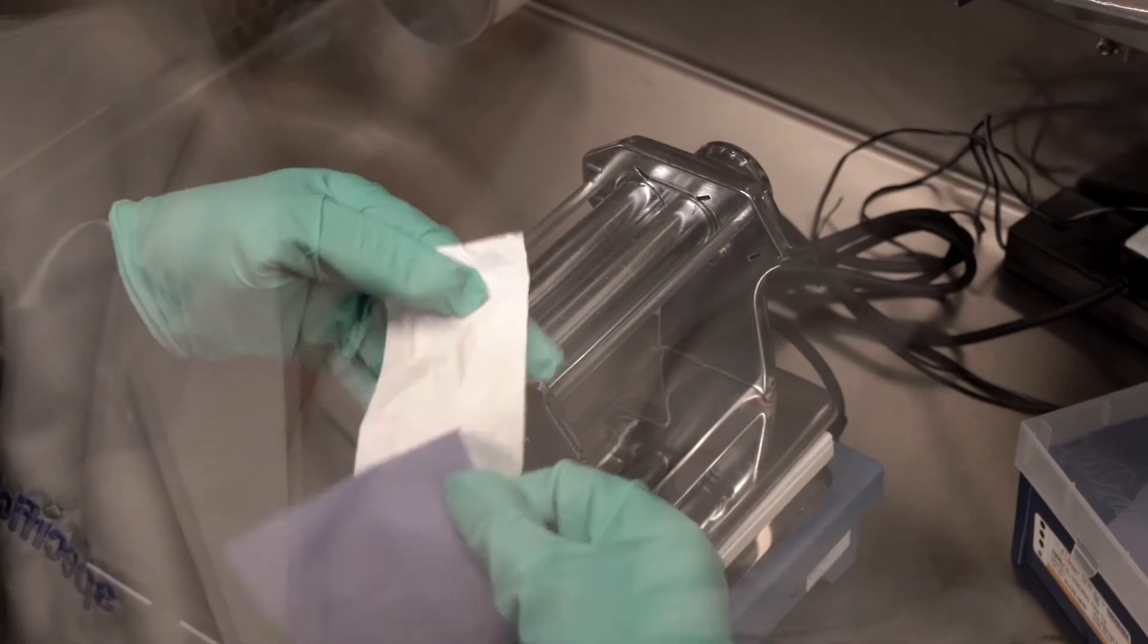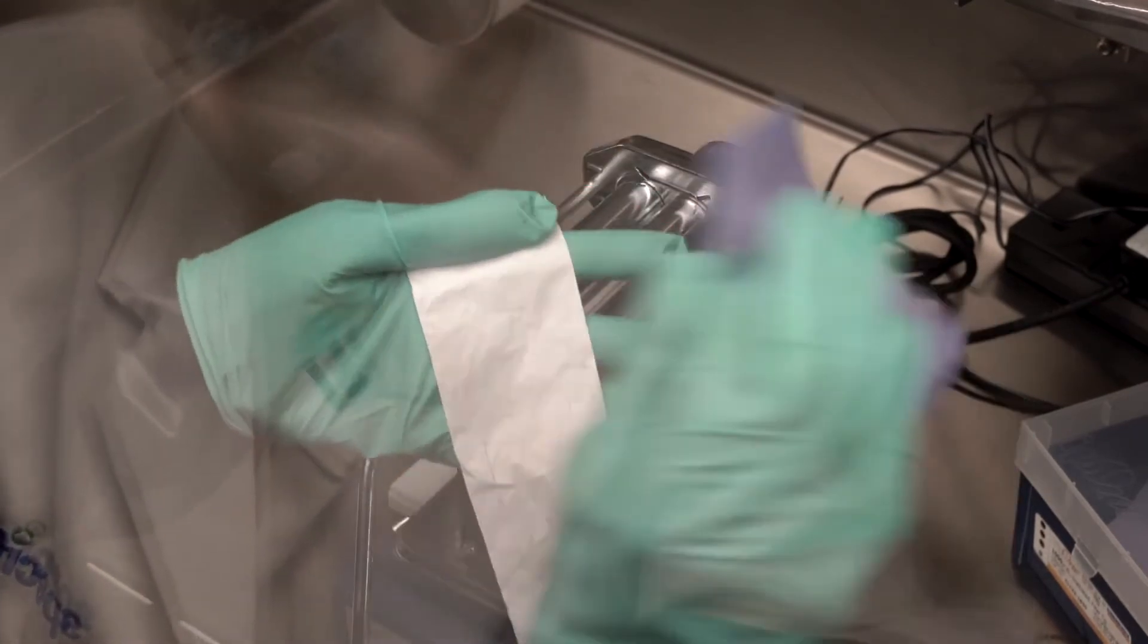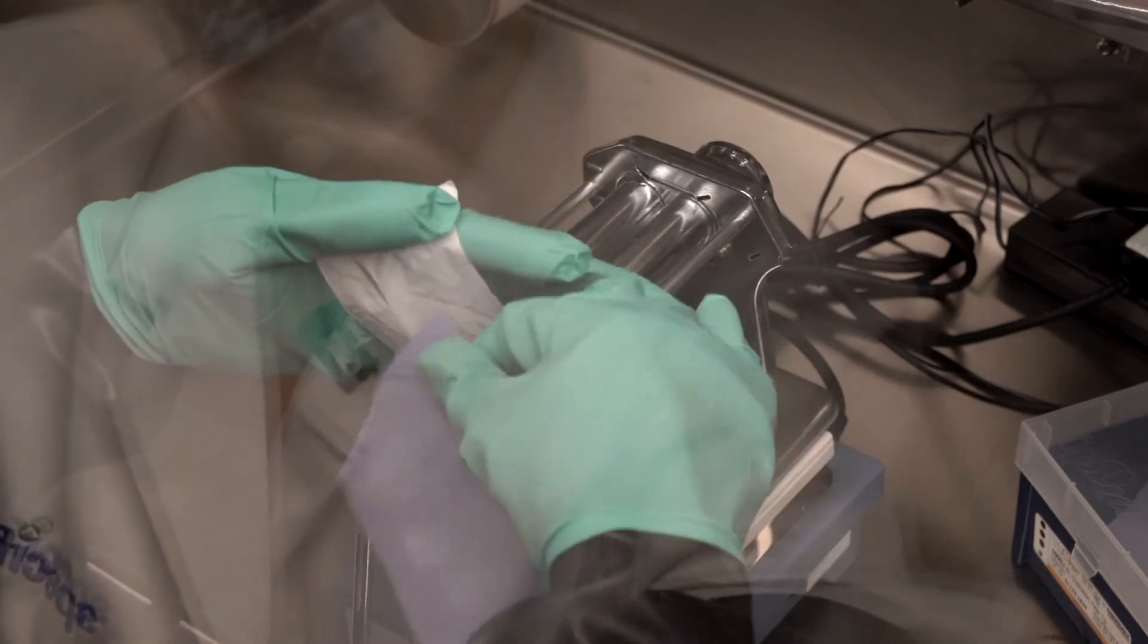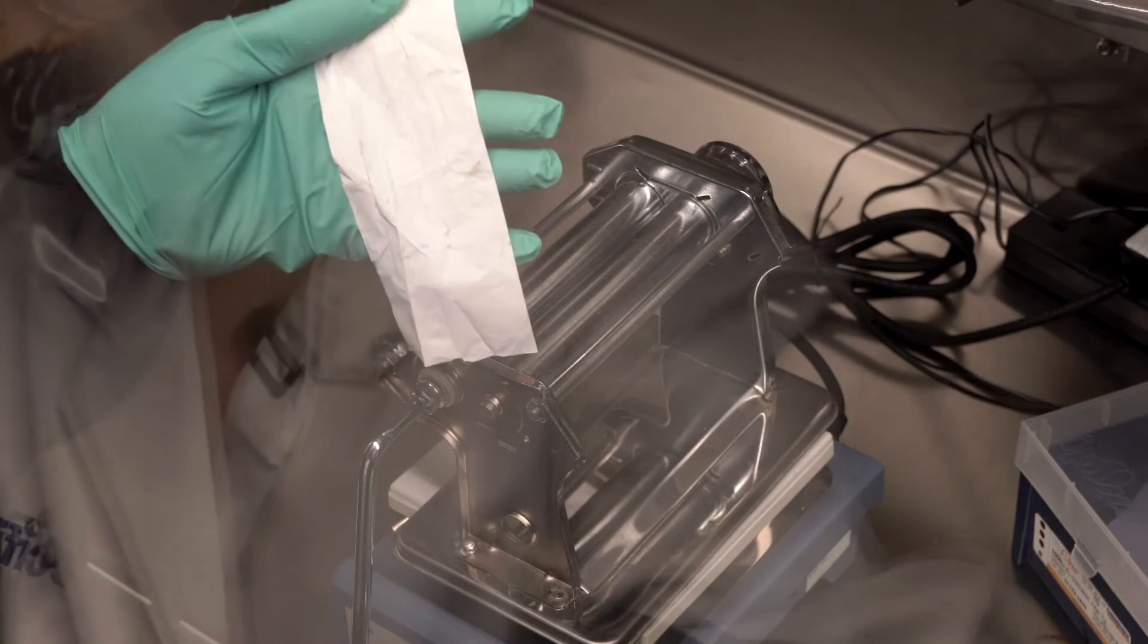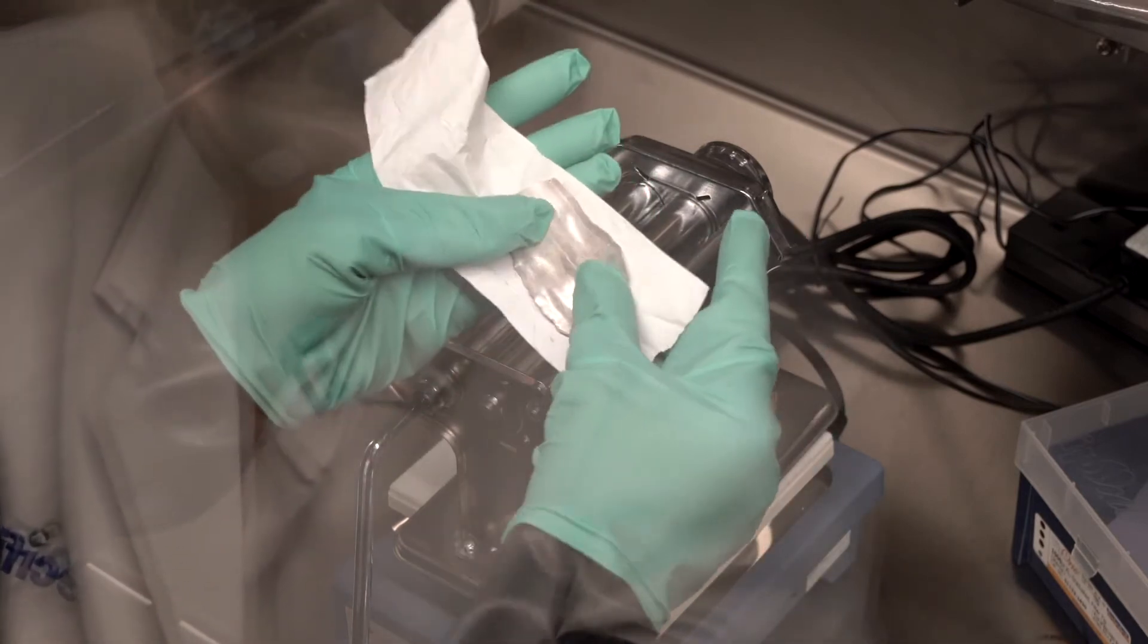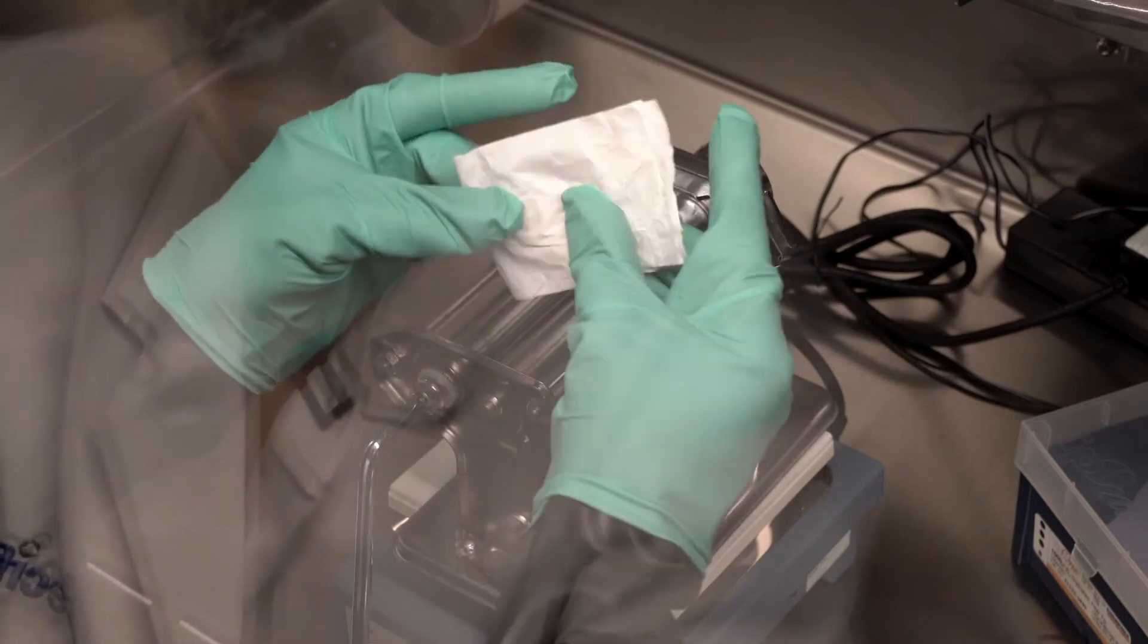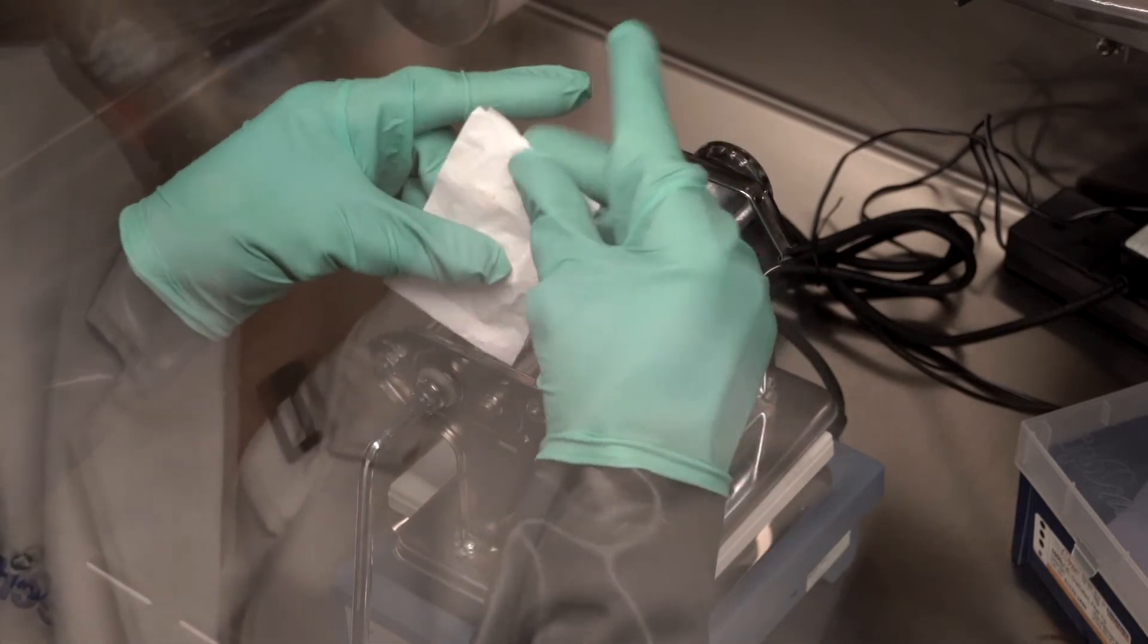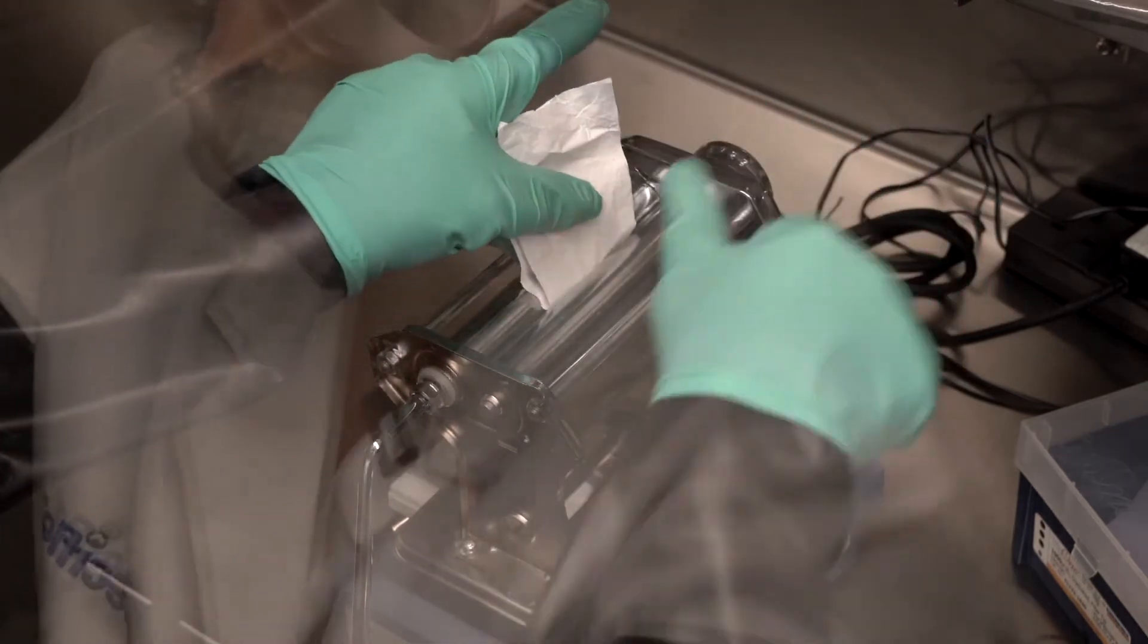So if I carefully keep that sodium in the separator, that will stop it from sticking to my rollers and tearing. See if I can get that to fit.